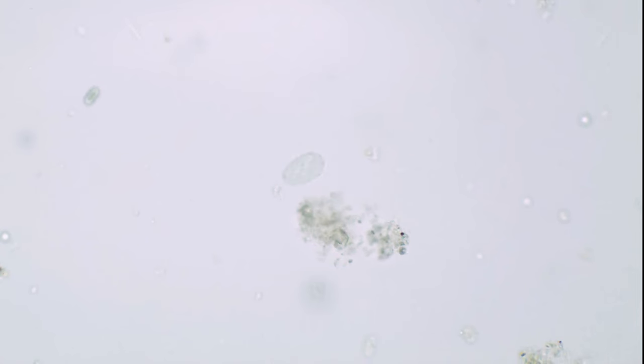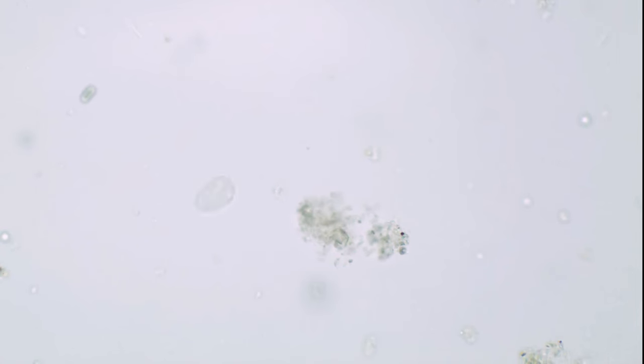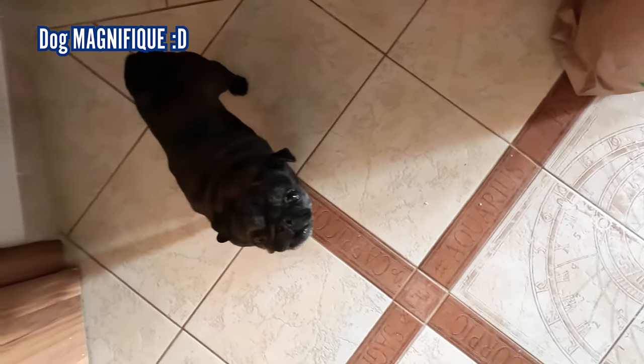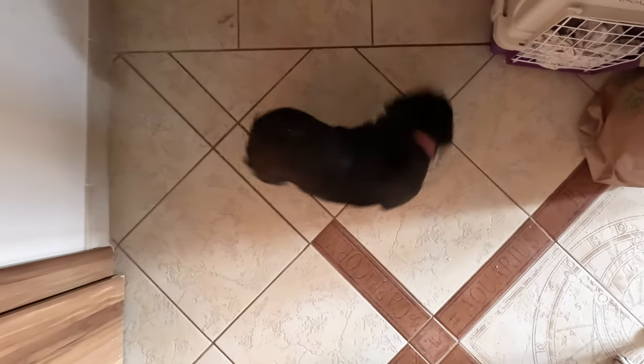And here's another ciliate — its cilia itself is not very visible because it is very thin. The specimen seems to really like spinning. One of my dogs also really likes spinning — she probably drank some of the aquarium water when she was a puppy. Maybe her love of spinning is due to an extraordinary abundance of these microorganisms in her body — that would explain everything.